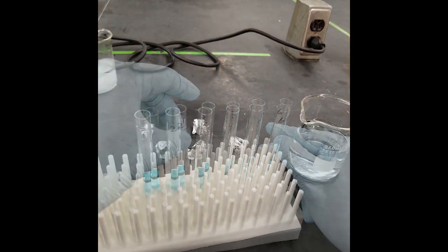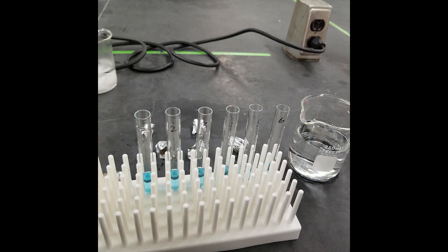Remove the foil caps to your tubes and add one ml of the Nelson arsenomolybdate reagent, but be careful to not add the reagent too quickly as tubes that contain considerable amounts of reducing sugar will bubble up.